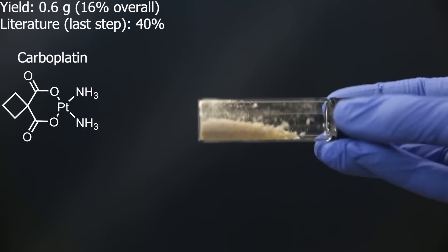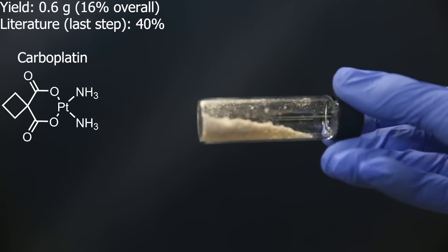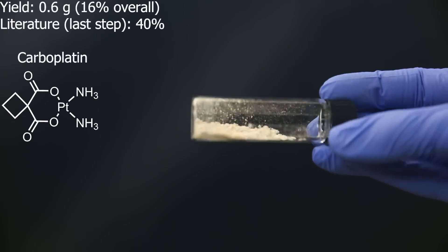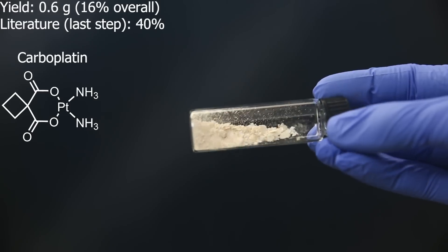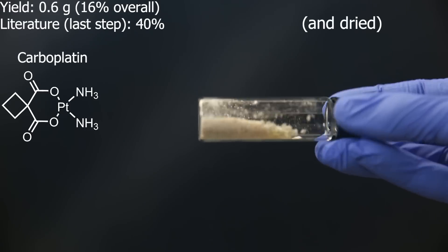And the yield turned out to be 0.6 grams of an off-white solid, which should be mostly carboplatin, which can also be a little discolored in literature sometimes. The overall yield is 16%, but I can't compare it properly to literature since I didn't isolate the products in between.